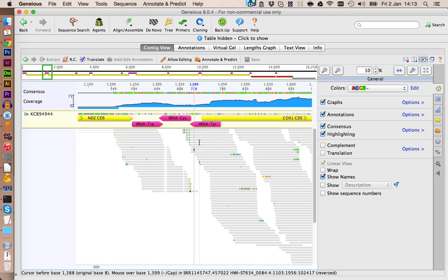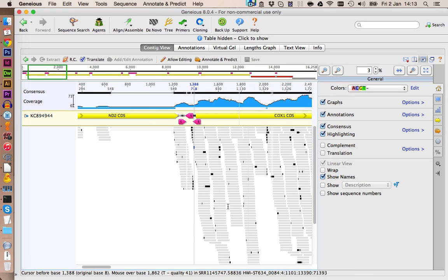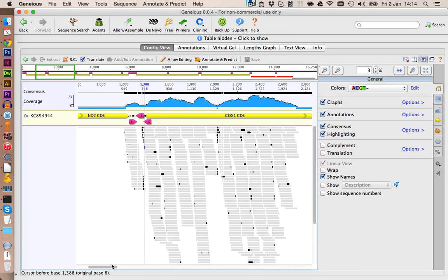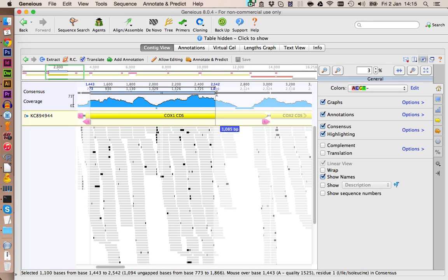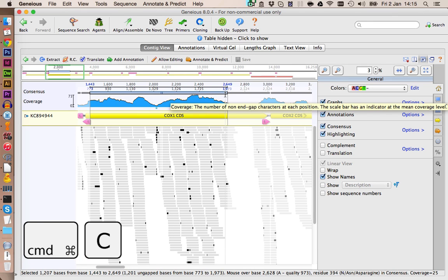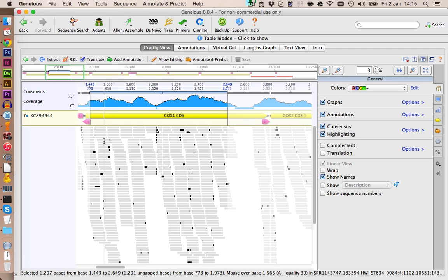much about these errors right now, because what we want to do now is take a look at the CO1 gene. This thing here now, the consensus sequence, is the actual sequence of Mesocapnia, so the organism where we have our next generation reads from. We can now copy this one here. Just press Command C. And we are going to use this one now to search for the reference genome, because we have now information about the organism, not just the genus.